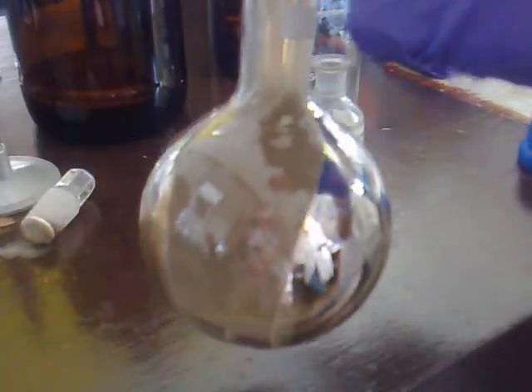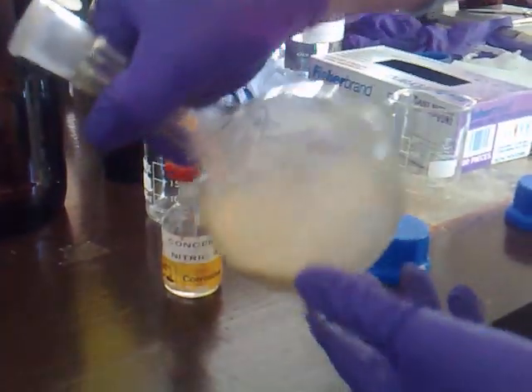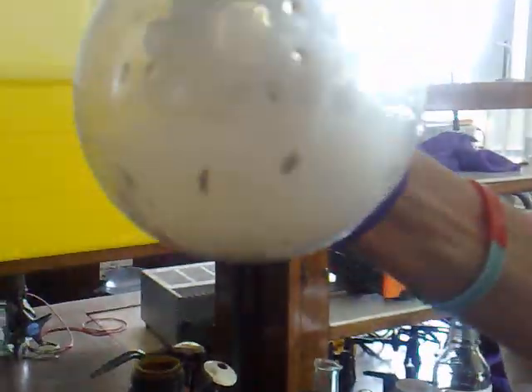It was not the noblest of noble methods. Let's touch this. Fantastic. Really good. Marvellous. It's all gone. Back to silver. Thank you very much. Very good. Thank you very much.